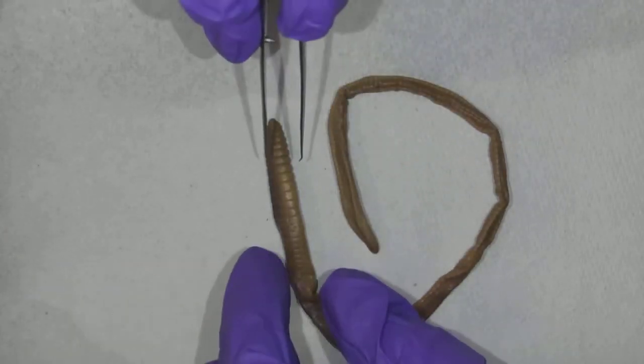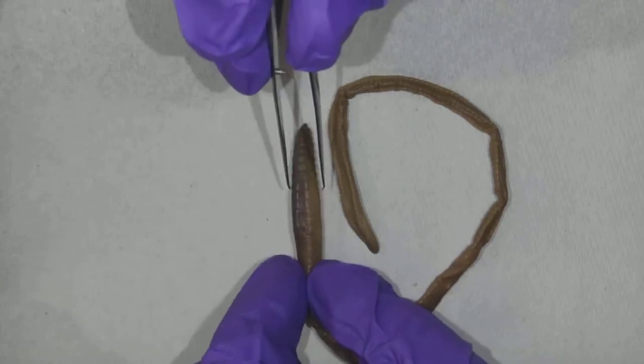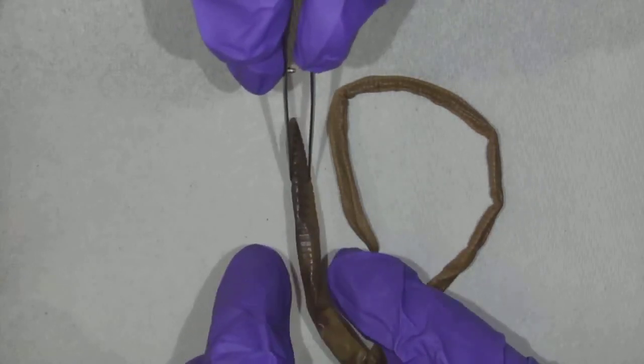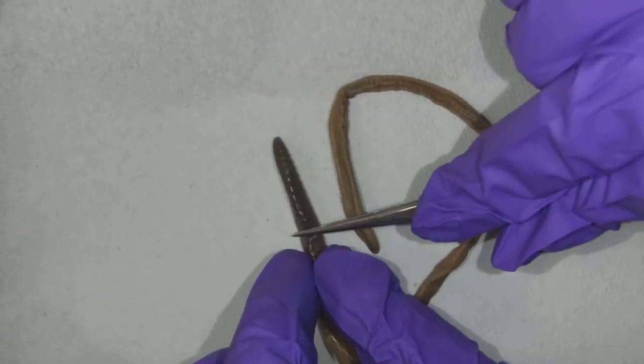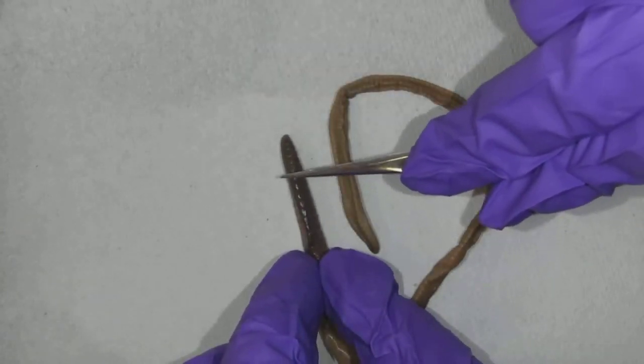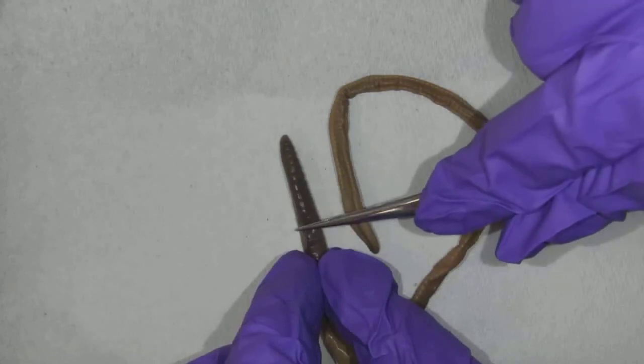He has been preserved, so I can cut into him and dissect him and learn about him. We are using these creatures to learn. We're not just killing them. We are learning from them. So the more we can learn, the better.